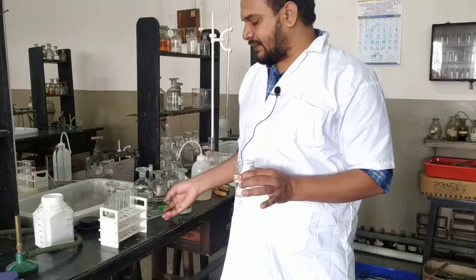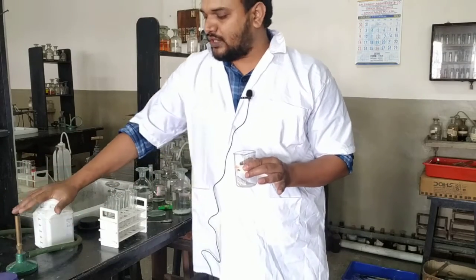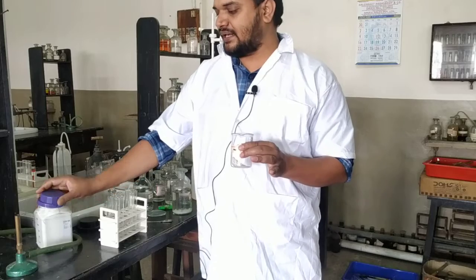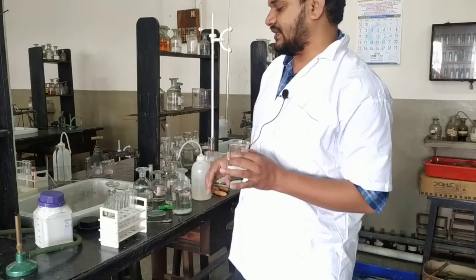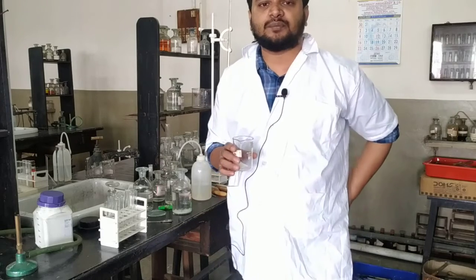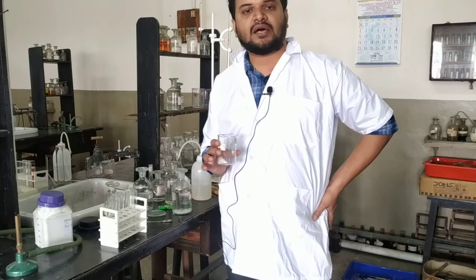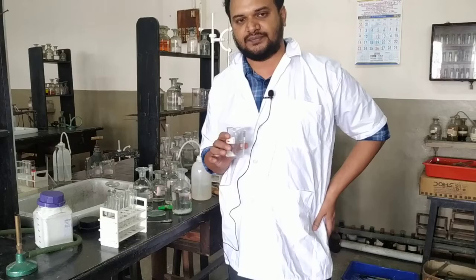Now basically, chemically, according to the principles of chemistry, sodium carbonate extract is prepared only for insoluble salt. But according to the ISC guideline, you will always be given a soluble salt. Then why are we making the sodium carbonate extract? That is actually said by the council. In your question paper, it will be written, how have you prepared the sodium carbonate extract? According to the principle of chemistry, sodium carbonate extract is needed only when your salt is insoluble in water.